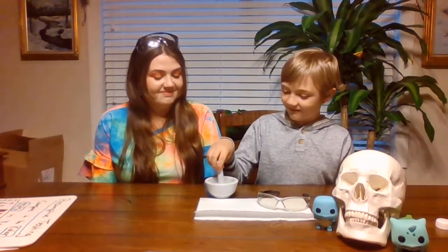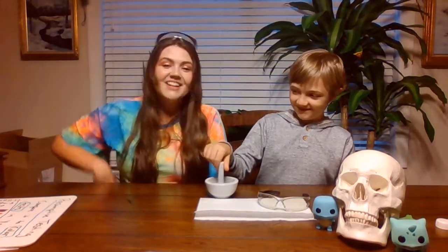So he helped me crush up the pills. You want to show them how you did it? So that's kind of the funnest part of the lab if we were in school is y'all actually get to use the mortar and the pestle to crush up the over-the-counter drugs, and that's what he got to do and he did have fun crushing it, right? Yes I did. So he crushed them up and put them in there and you'll see those in a second how we're going to test them.